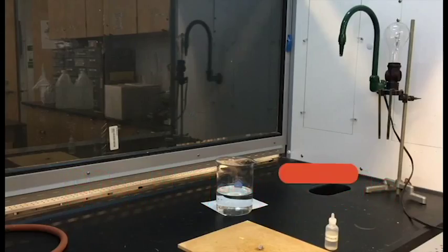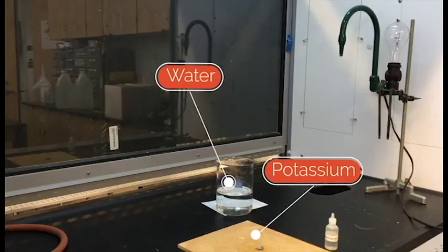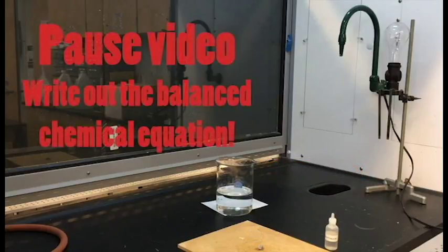In this demo, we're going to react potassium and water to form a basic solution of potassium hydroxide and hydrogen gas. This is a very exothermic reaction.